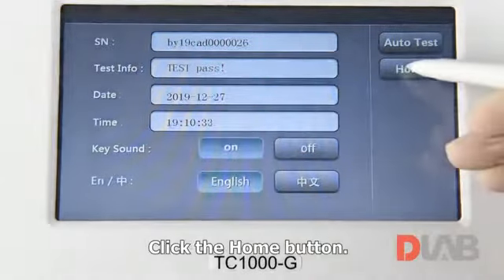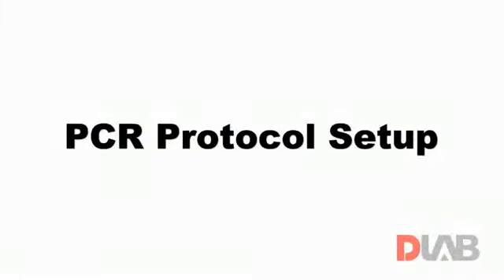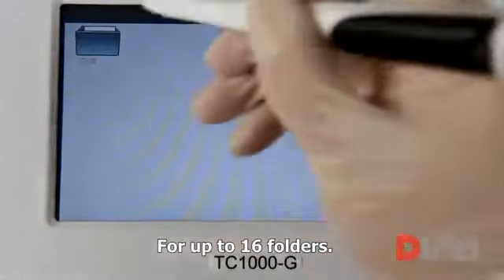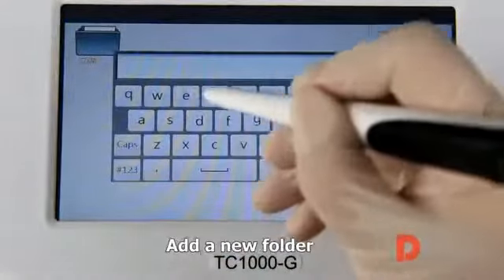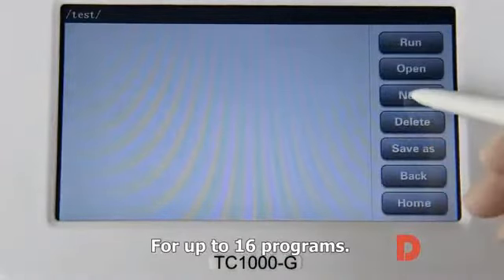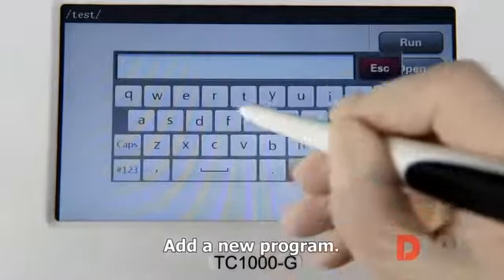Click the Home button. PCR protocol setup. Click the File button to show the folder page for up to 16 folders. Add a new folder. Double-click to enter it for up to 16 programs. Add a new program.